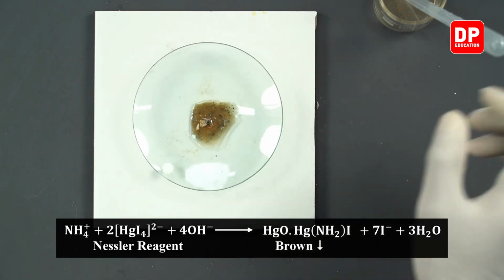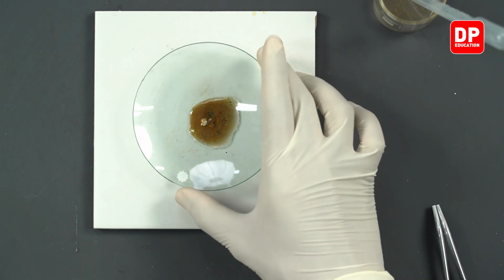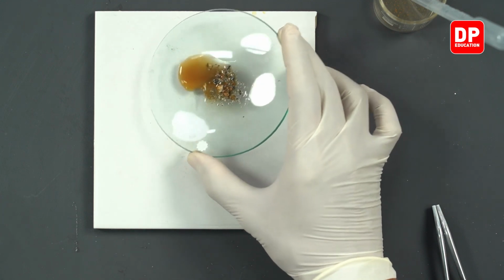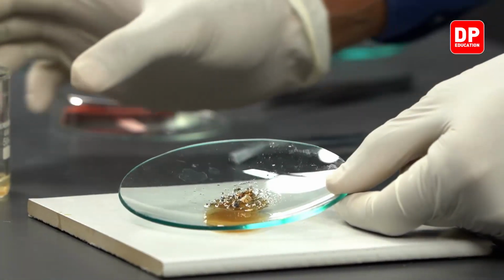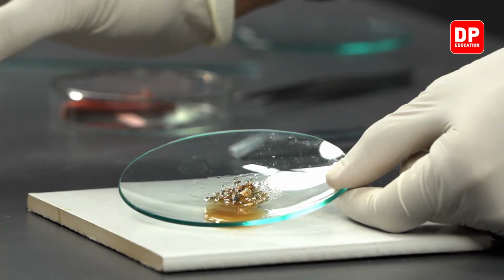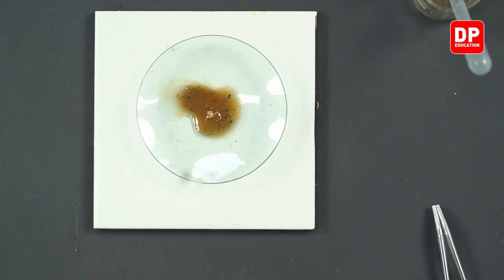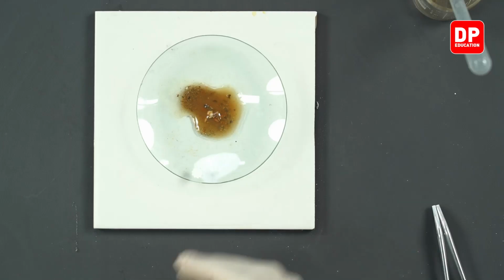As you can see students, when you add Nessler reagent, you can see the formation of a brown color precipitate. Nessler reagent is a clear solution, but as you add Nessler reagent onto this magnesium nitride, magnesium oxide residue, due to magnesium nitride reacting with water, it forms ammonia and it turns this Nessler reagent into a brown color.